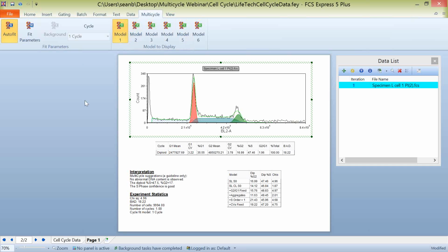So you may have to pick and choose, depending on your data, which models you want to use. Of course, if you're working with some data and you have chi-squared values that are very, very high, with some other ones in there that are very low, you may want to go through there and review which one is going to make sense the most for your data. And again, the model can only do so much, right? We are going to model the data. We're going to try and use Multicycle to do it as quickly and as efficiently as possible.